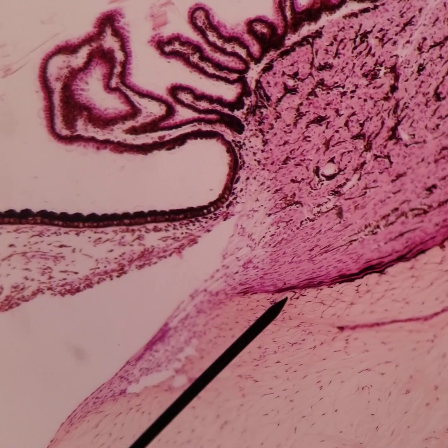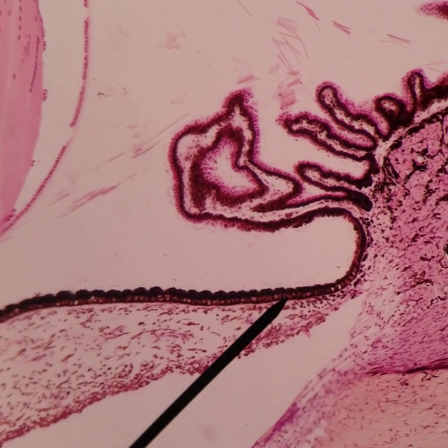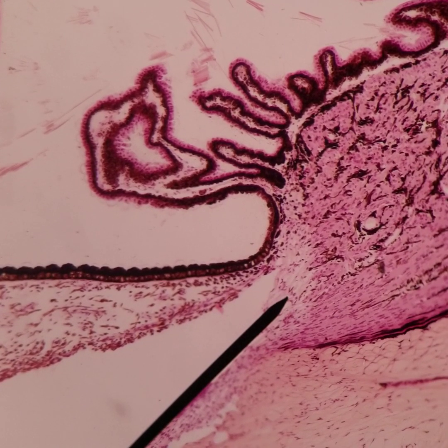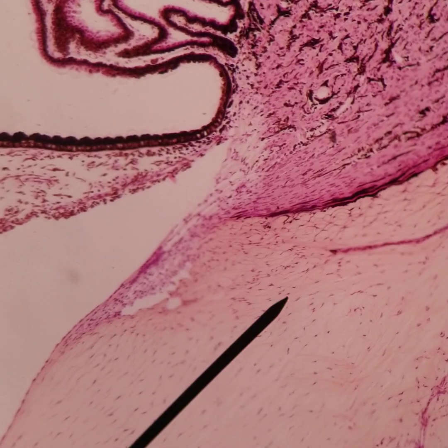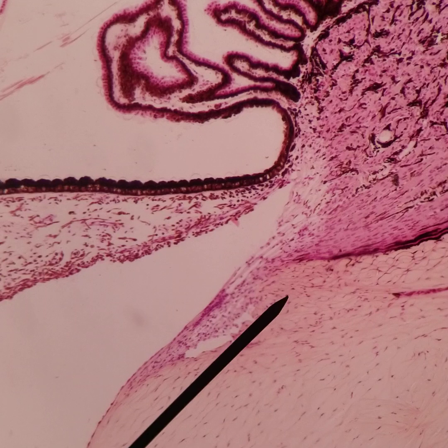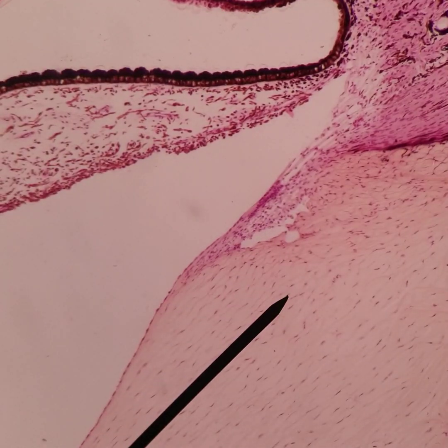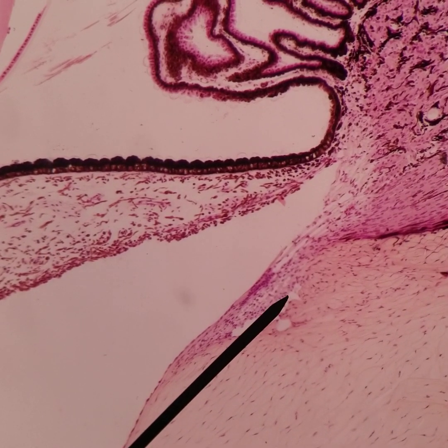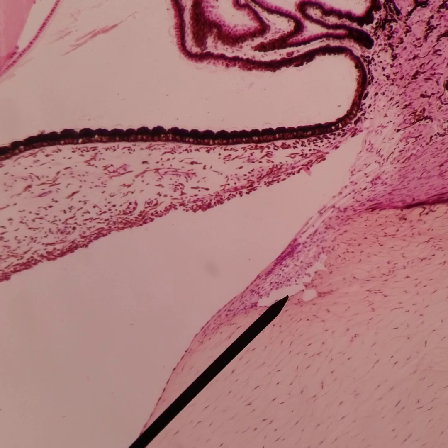This is the physiologic angle we've talked about. We have the iris root — you can see where it's very narrow — and just anterior to that is the anterior face of the ciliary body, which attaches to the scleral spur. Just anterior to the scleral spur is the trabecular meshwork, which gets a little denser, and then we have Schlemm's canal — this larger empty area — slightly more peripheral than the trabecular meshwork.